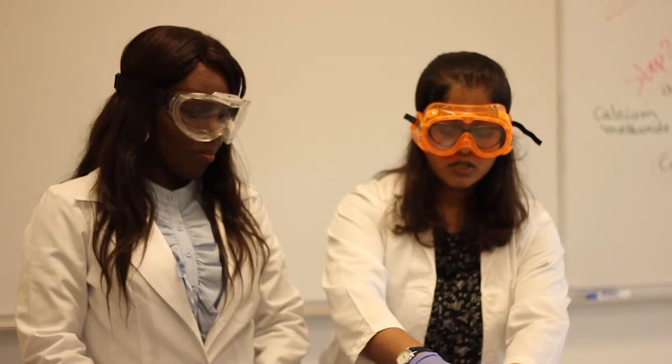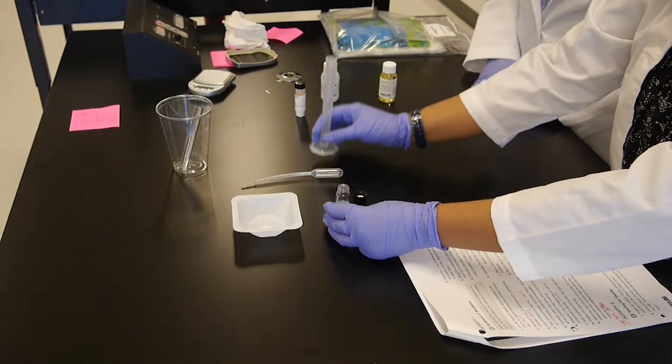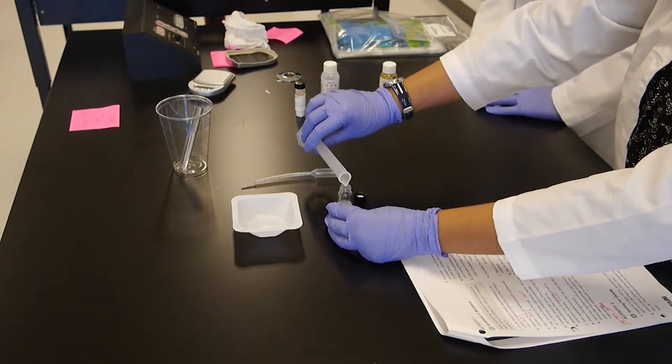Okay, after 10 minutes, let's open up this vial. You have to be careful. Keep it away because pressure might build up. Then we add 1 ml of vegetable oil in it.